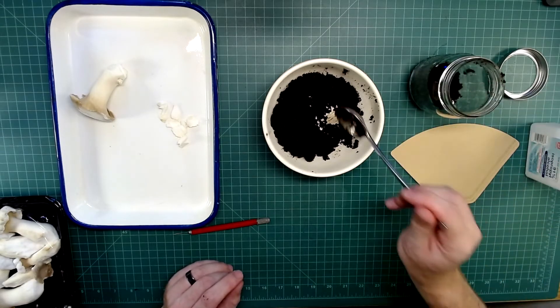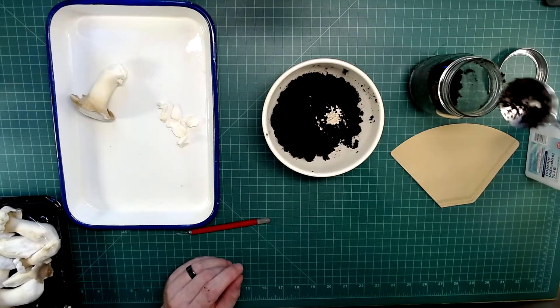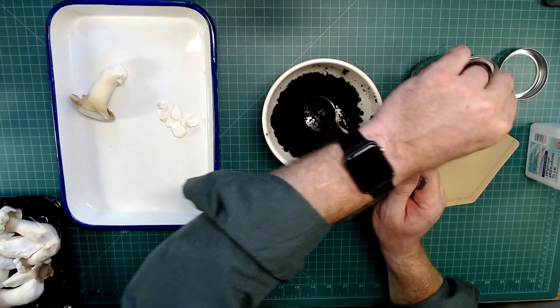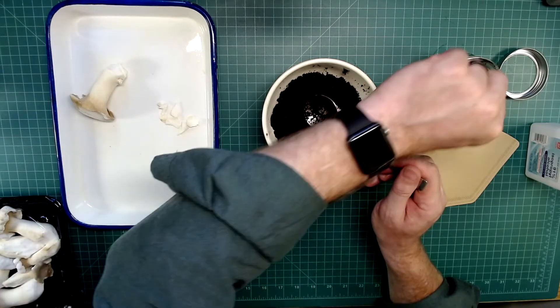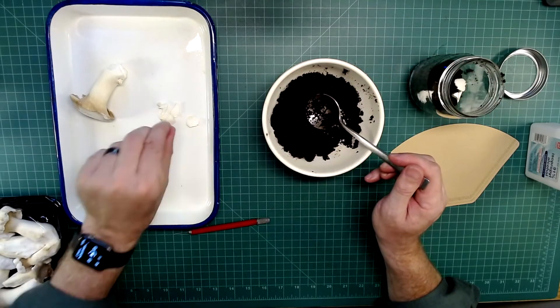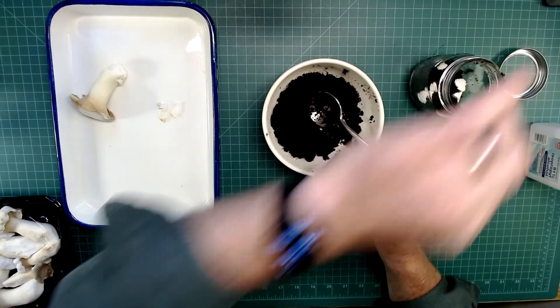When I've prepared this material in the coffee grounds in the past, I use a metal strainer. I basically make the coffee, let it cool down with the lid on so nothing can get in, then clean my hands with alcohol and do a little press with the back of my hand to push extra water out so I just have moist grounds.